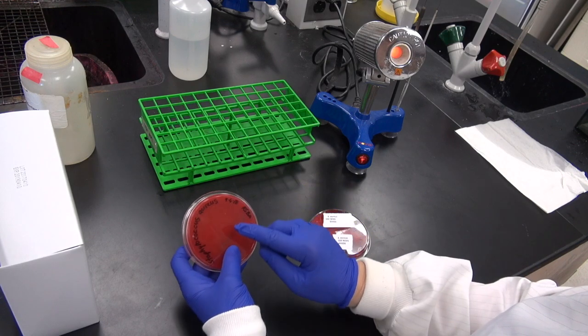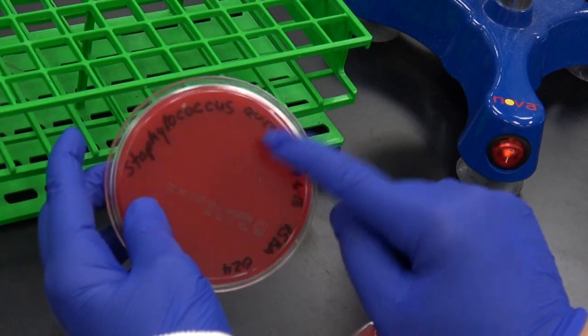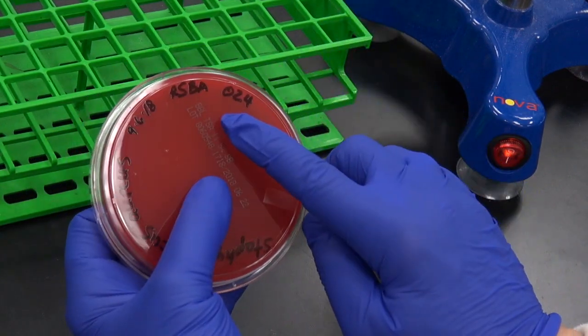We have already labeled our new plate with our initials, the name of the organism we will be streaking, the date, and the section number.